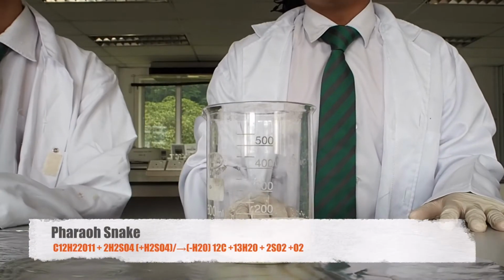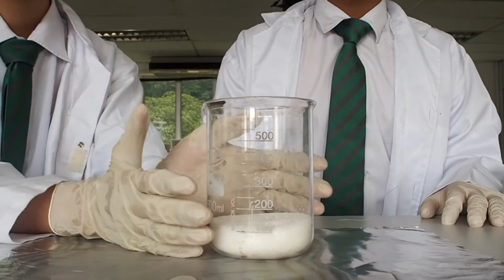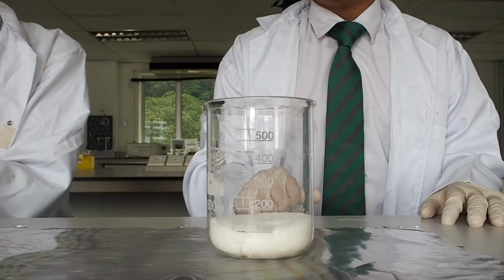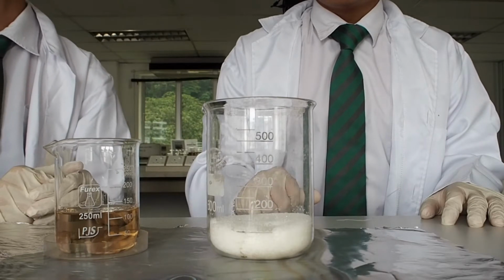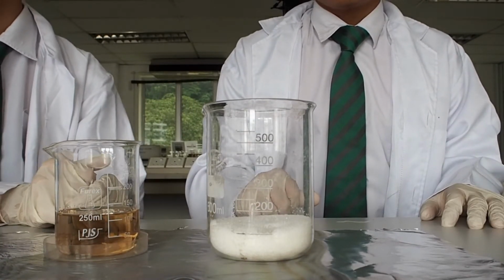So now we'll be doing the Pharaoh's Snake. Yes, here we got sucrose, which in common terms is sugar, and here a very dangerous acid called sulfuric acid. Today we are going to mix these two chemicals together and we will form the Pharaoh's Snake.